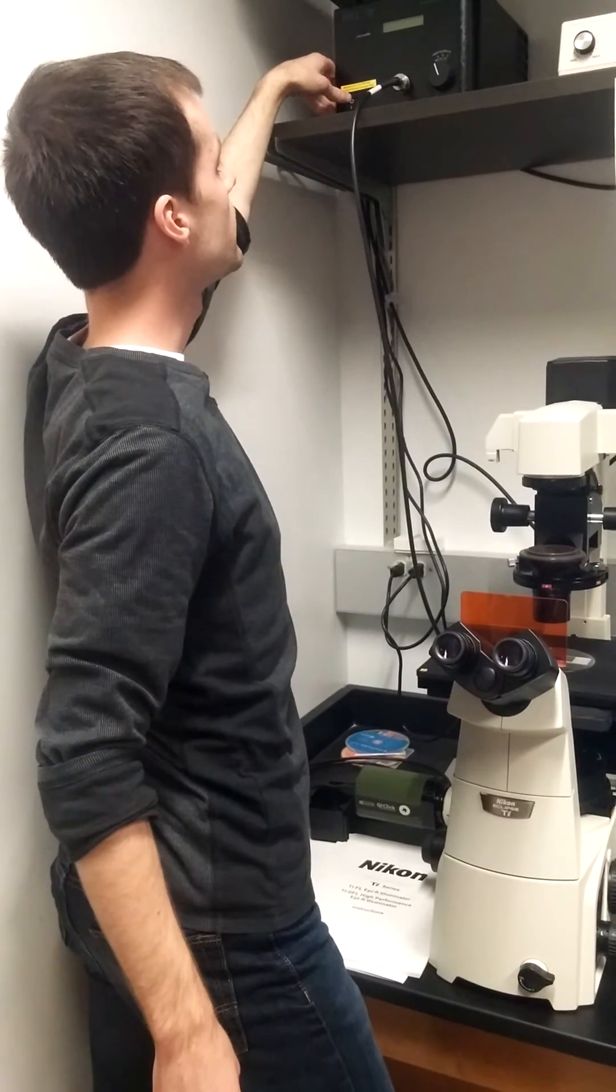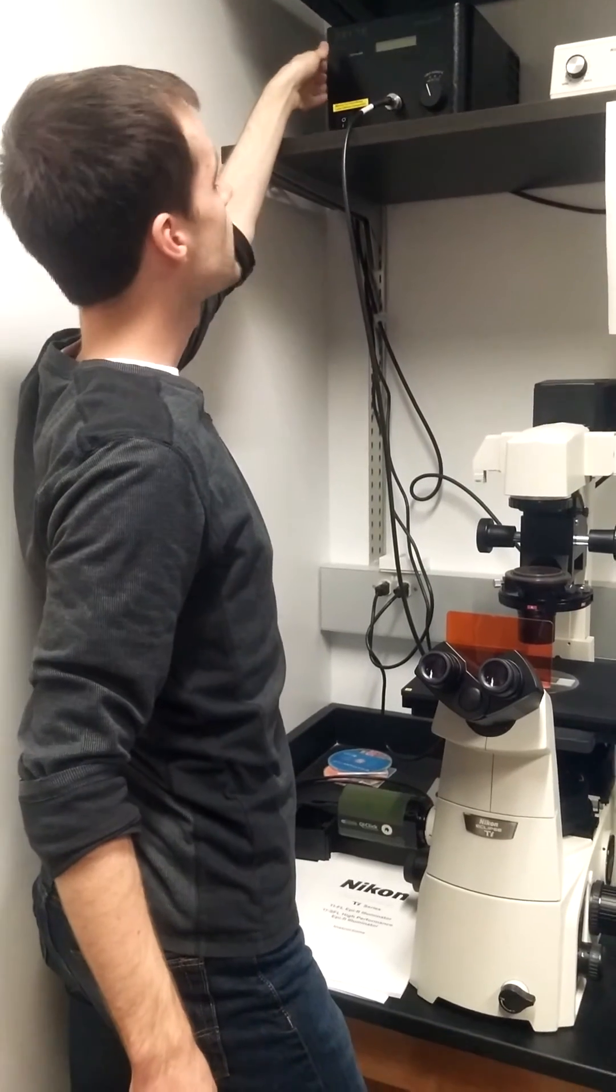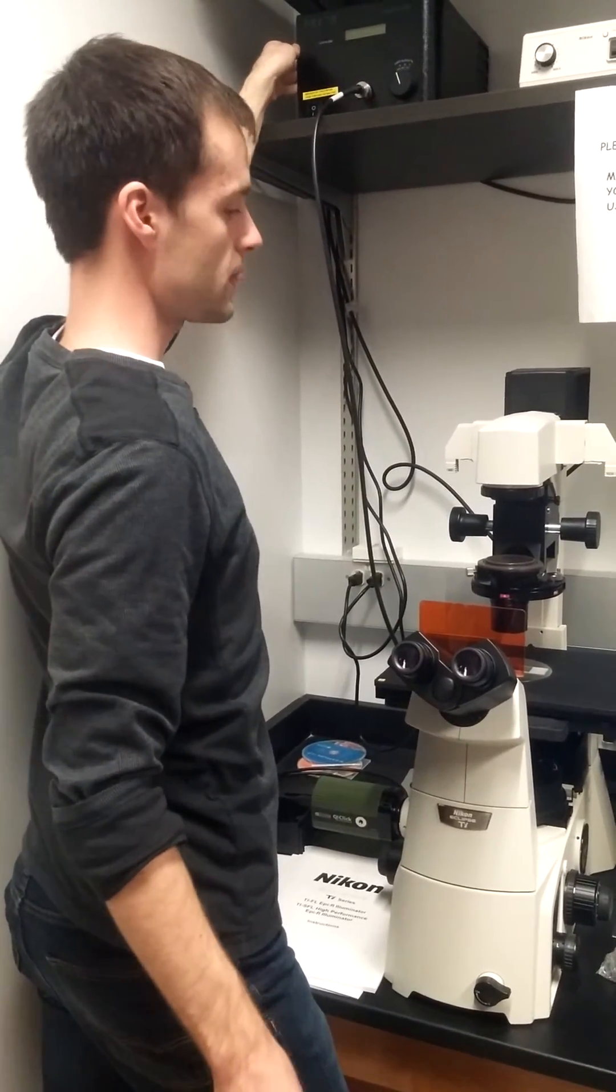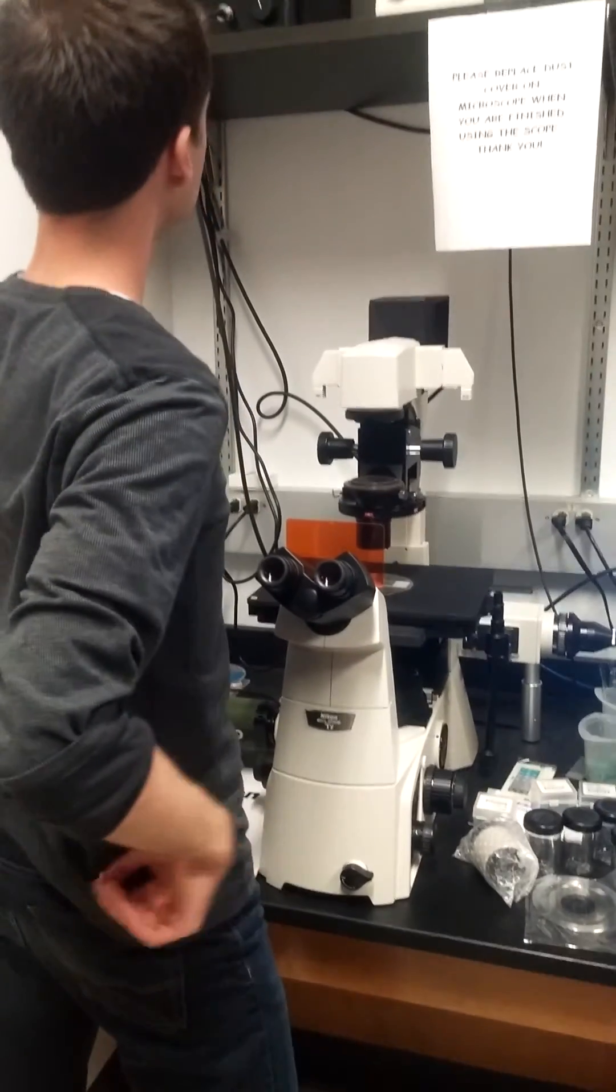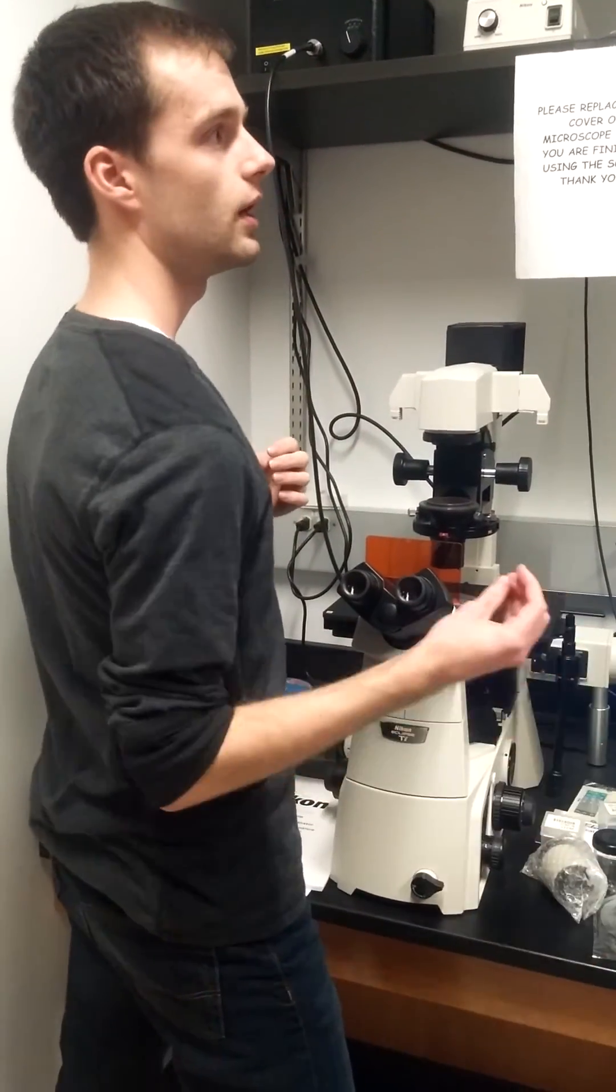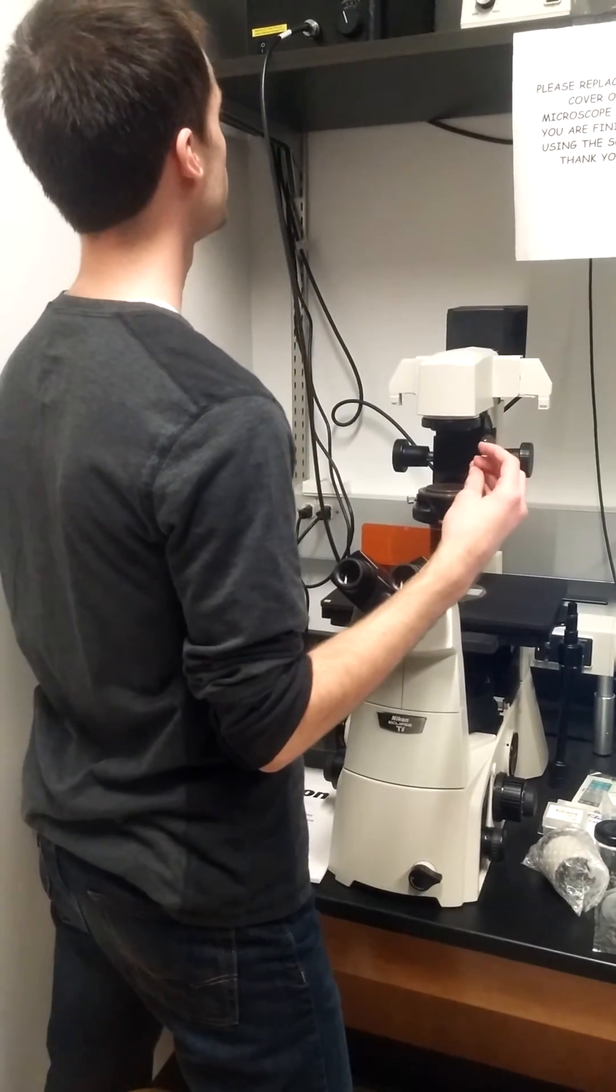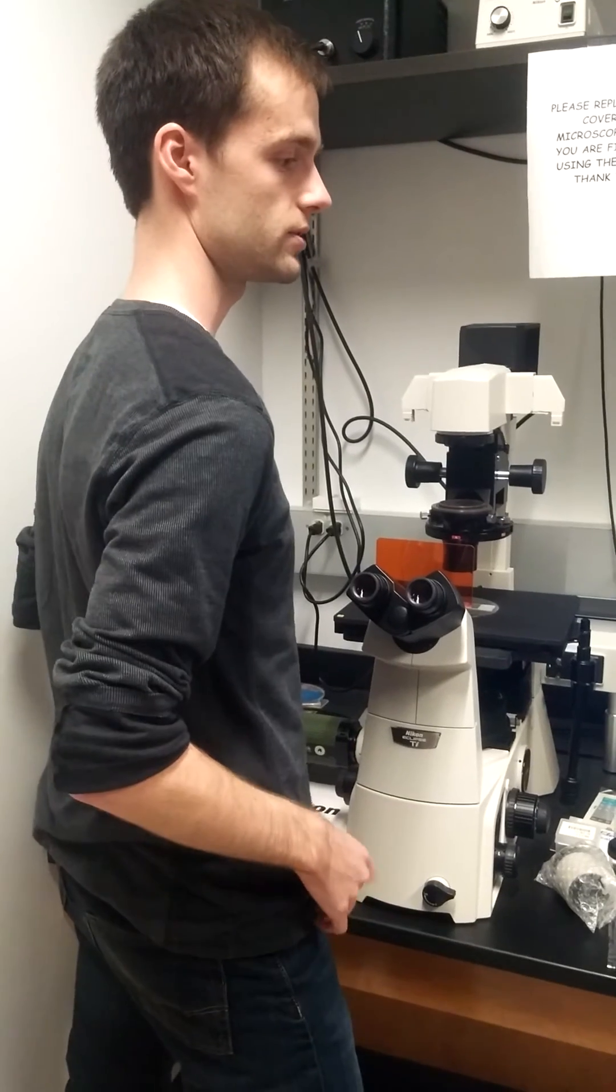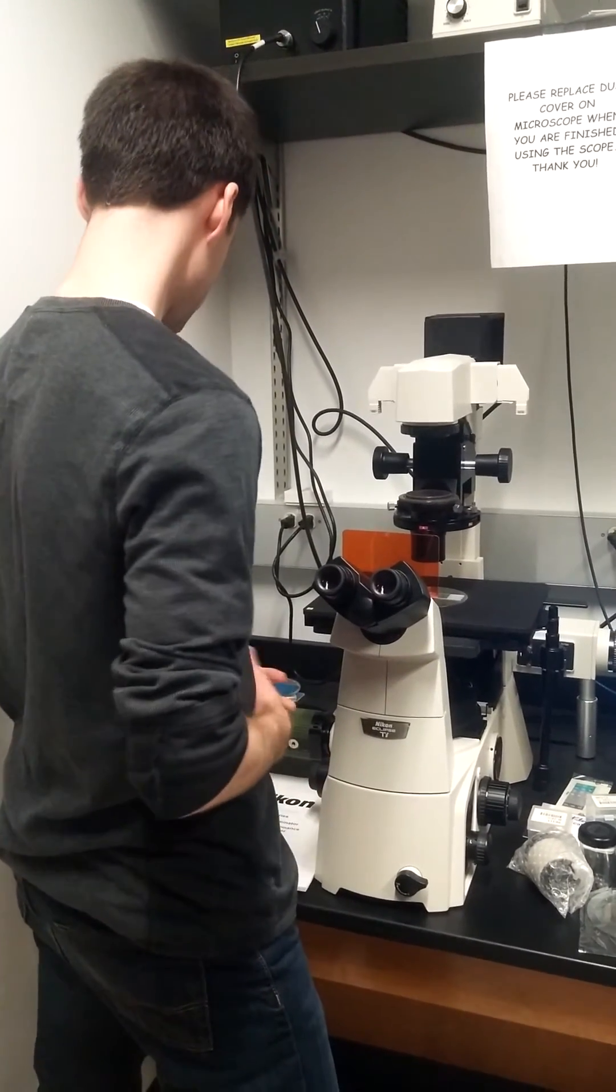It's important that you let this warm up for a little bit before you use it. And also don't turn it off right away. If you're going to use it, if you turn it on, make sure that you leave it on for at least five minutes so you don't damage the bulb. Don't turn it off right away.